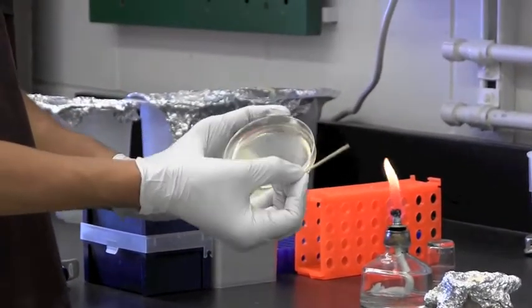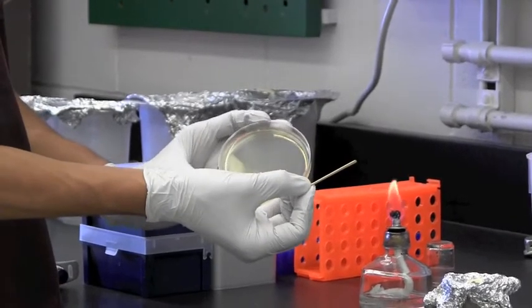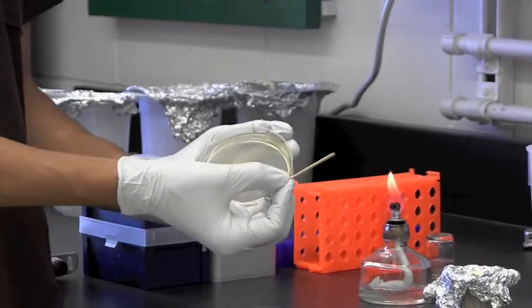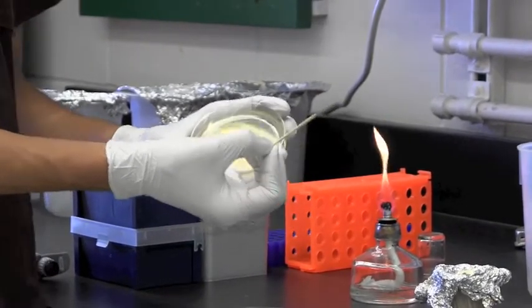And by now you want to make sure that your spread plate is dry so that your patch stays put in one place and does not diffuse into other areas of your culture.